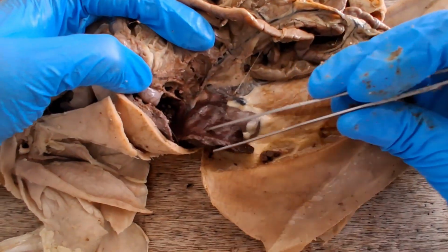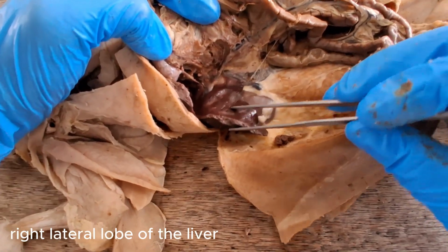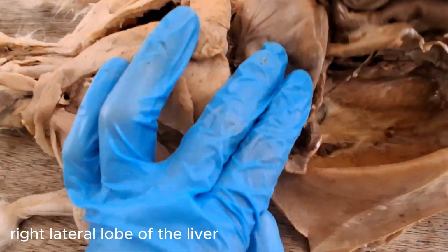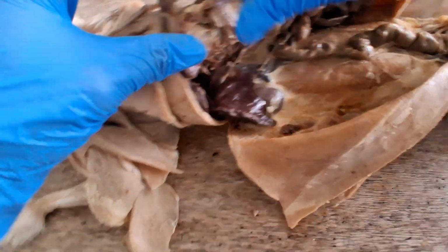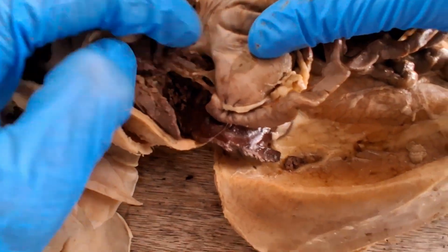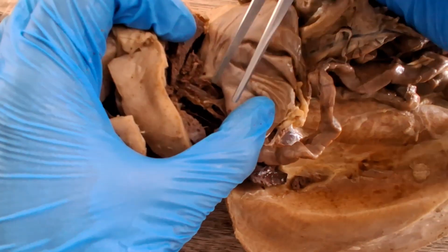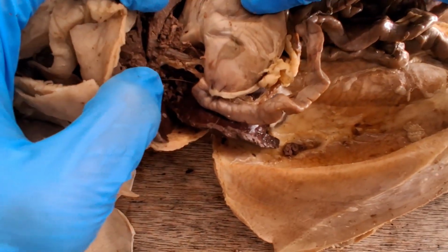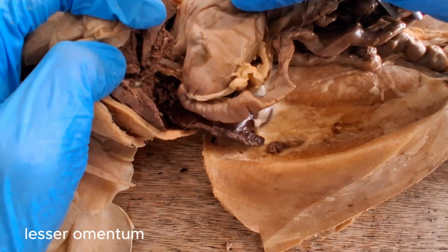So there's the lateral right lobe of the liver. If you look here in the lesser omentum, there's a mesentery there covering some of the structures, but I already ripped it apart to better see them. So that mesentery that I destroyed would be the lesser omentum.